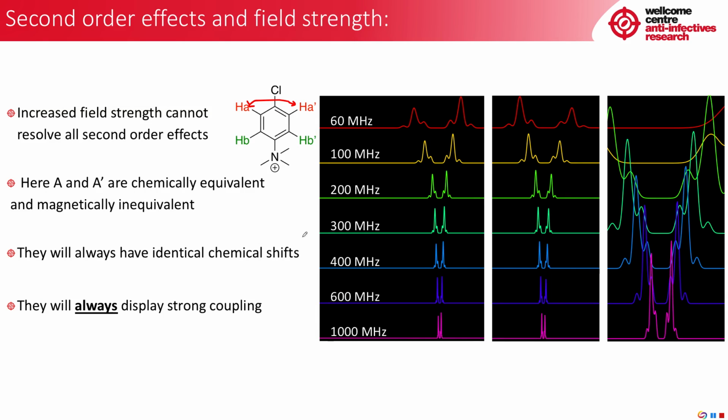And again, we can demonstrate this by simulation. We can see for our 60 megahertz signal our quite distinctive standard second order shape for one of these signals. And as we go from 60 all the way down to 1000 megahertz, you can see the signal gets a great deal narrower, but actually, if we blow it up over here, and you look, although it's sharper, the shape of this signal, even at 1000 megahertz, is actually the same. These will always give a second order effect.